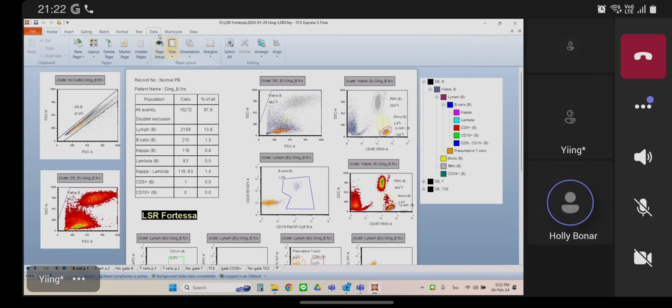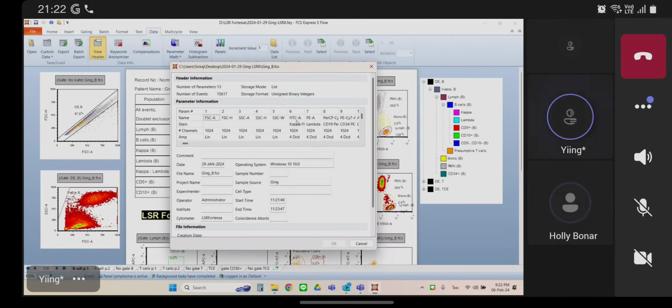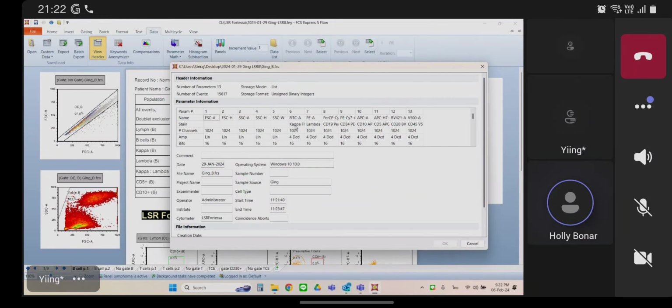Okay. And so this data, now before we do anything, click on the plot in the middle, just like we did in the other layout. Oh, undo. Yeah. Okay. Now go up to view header, just like we did. So in this one, it works and you've got 5 scatter parameters, right? 2 forward scatter, 3 side scatter. So that's totally fine because this template works with those parameters. So no problem. So go ahead and hit cancel.